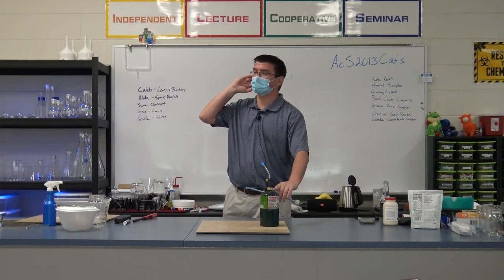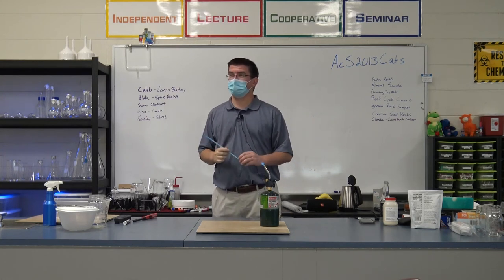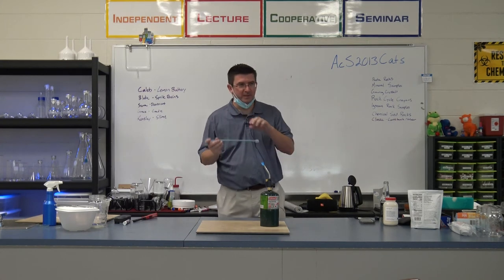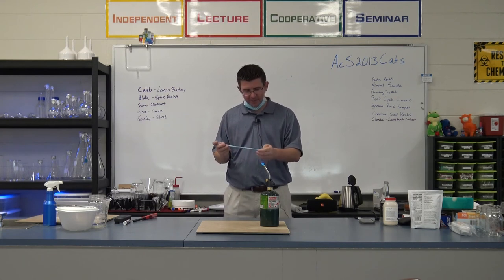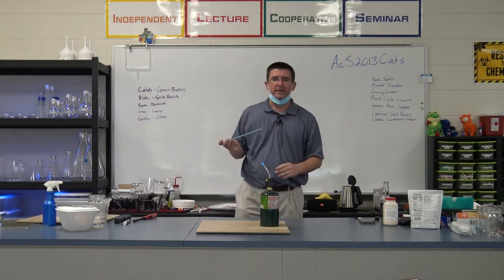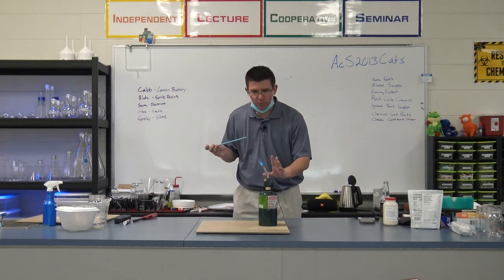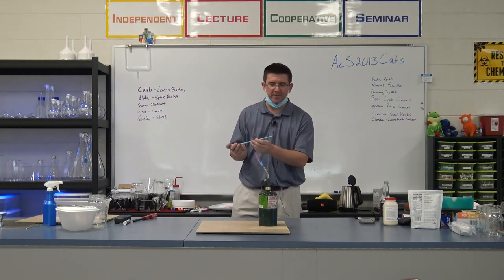Say something louder. This might make a loud noise, right? Might make a bigger fireball too, right? Let's find out. So, here we go. All right, we've got a straw full of this lycopodium powder. And on the count of three, I'm just going to blow it through the fire. Watch carefully, see if you can see what happens when this combusts, when it burns very completely and very quickly.